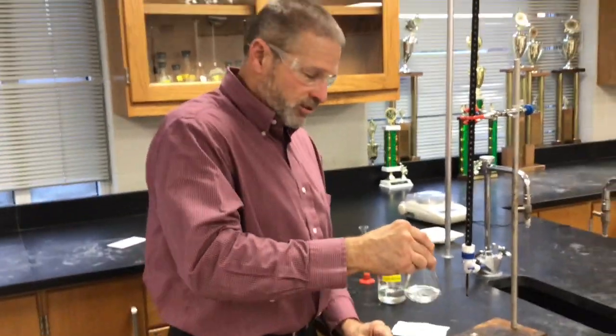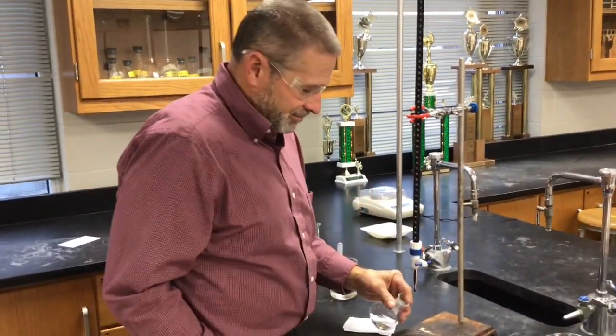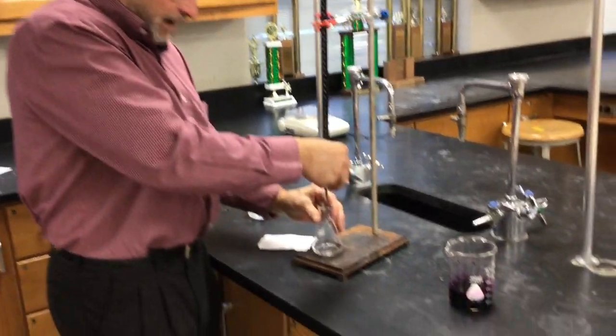I mean, honestly, it's not my grade, so if it's not exactly right... Yeah, I mean, we're not suffering at all. Yeah. Okay, here we go.